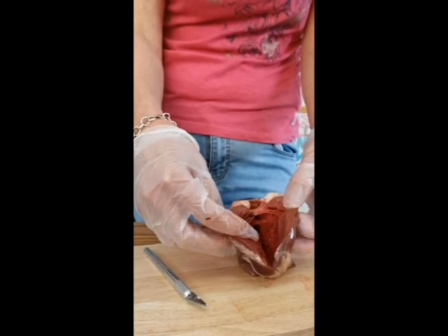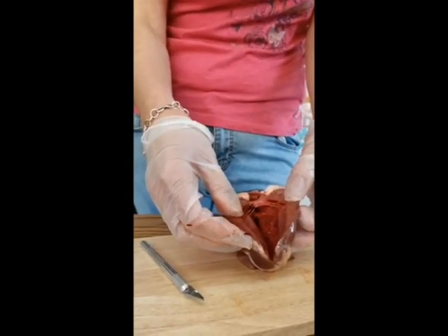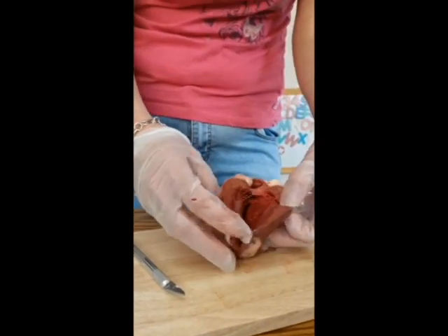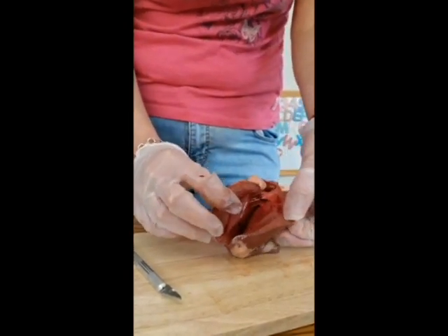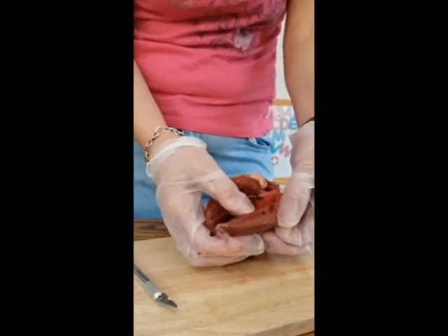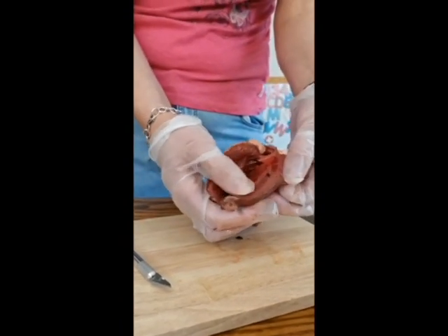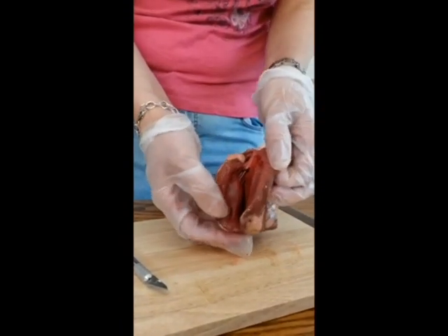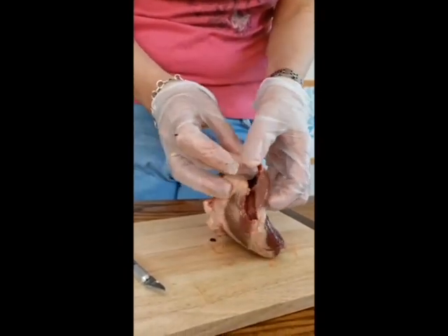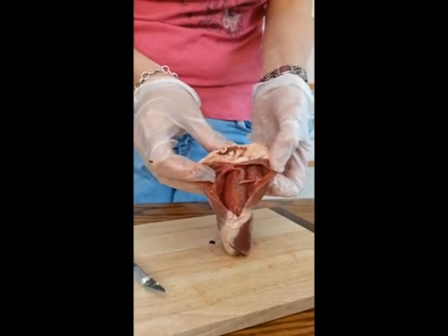So this side of the muscle has to pump blood to the ends of your fingers, to the ends of your toes, and it has to push the blood quite far. So because it has to push it quite far, it's a bigger chamber, and it's also got thicker muscular walls here, because bigger muscles can obviously provide a bigger force. So that's why the left-hand side of the heart has thicker muscular walls there. If I just flip it over, show you the right-hand side so that you can compare, hopefully you can see that it is much thinner.